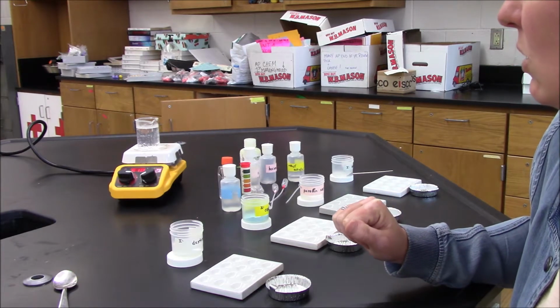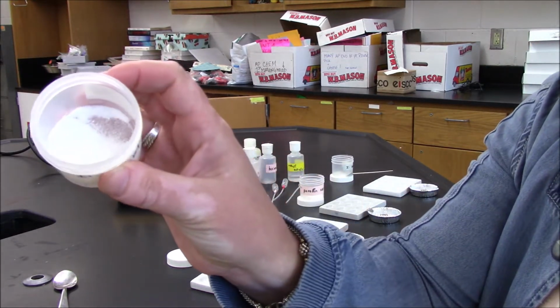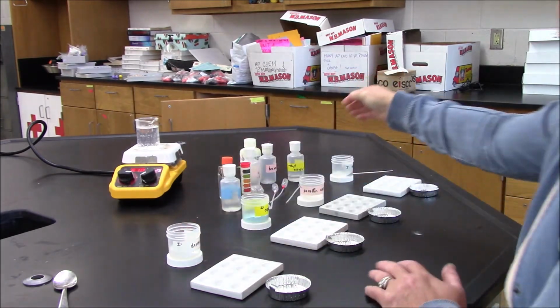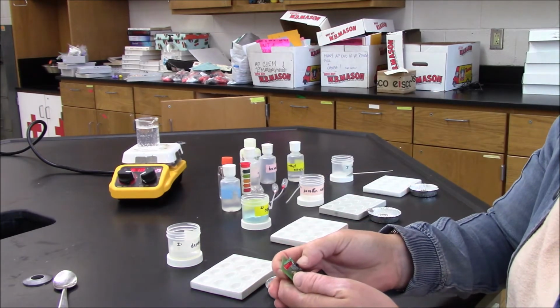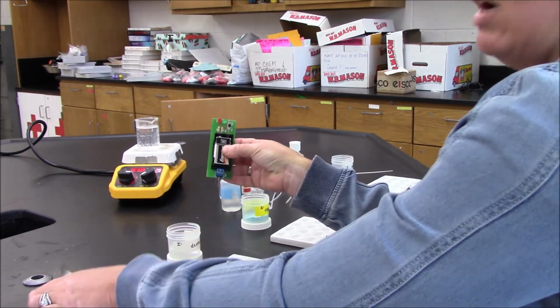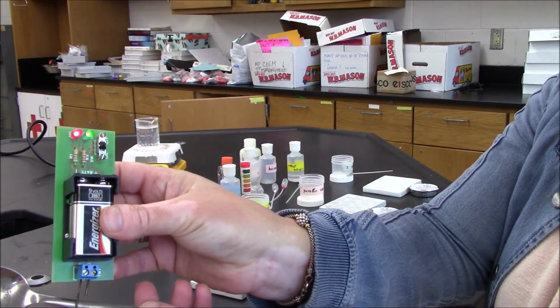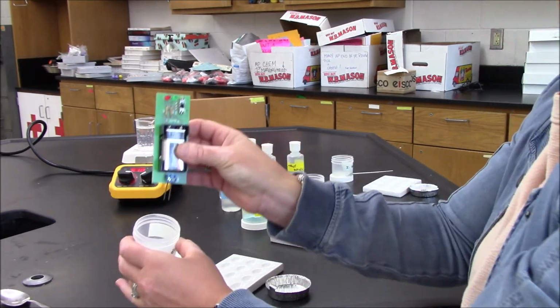Okay. So we can start here with dextrose. As you can see, dextrose is a white crystalline solid. In my first test, I can check for conductivity. This is a conductivity meter. You can see if I test it with something that is a metal, the lights go on. All right, so metal is a known conductor, so I know it works.